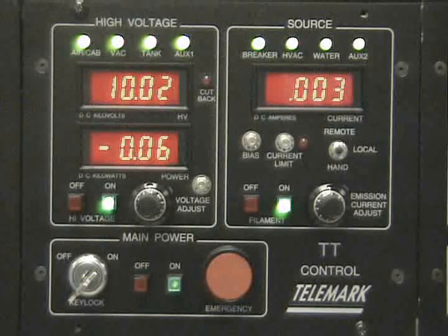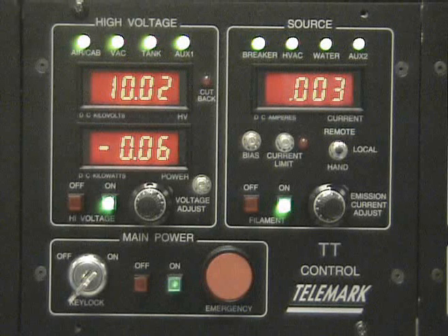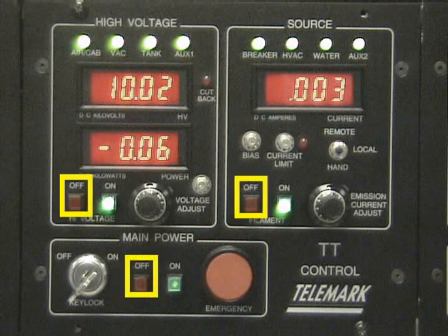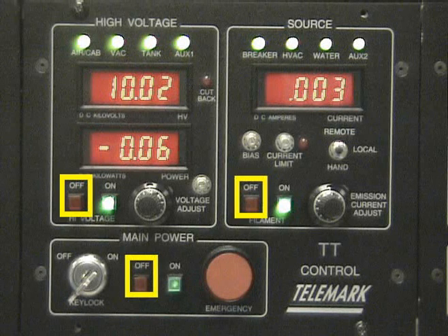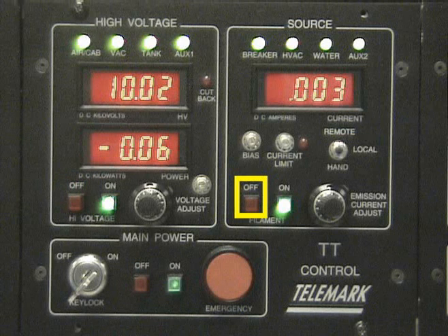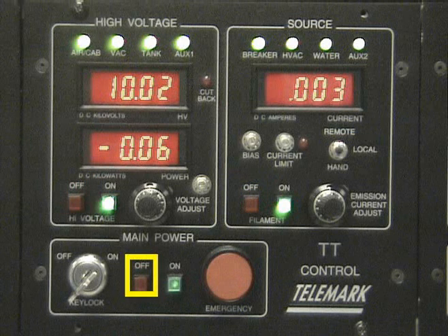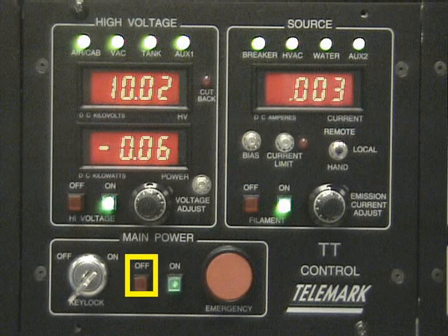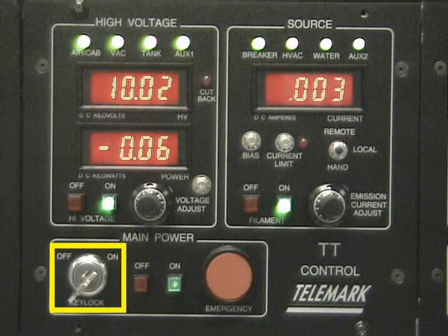We need to shut down the power supply. In order to do this, we turn the OFF buttons in a counterclockwise direction. We start by turning filament to OFF, high voltage to OFF, the button next to the key lock to OFF, and then we turn the key lock to OFF.